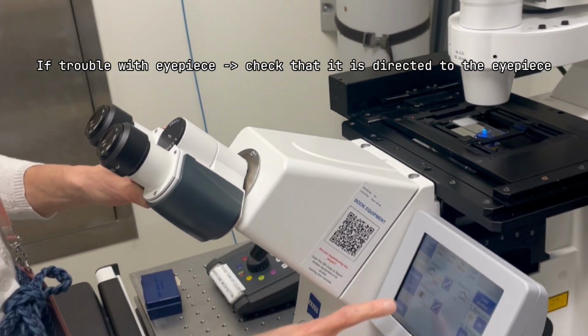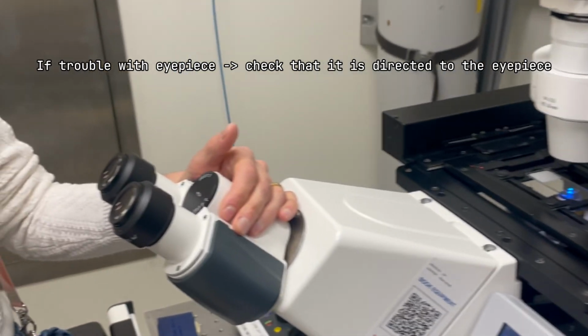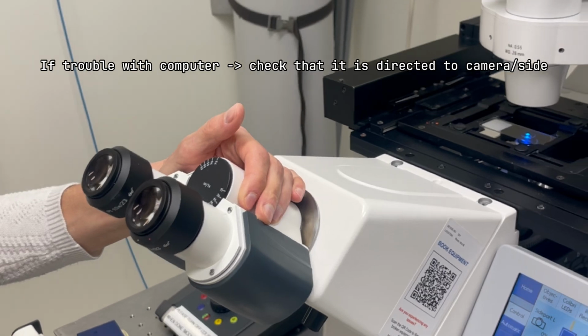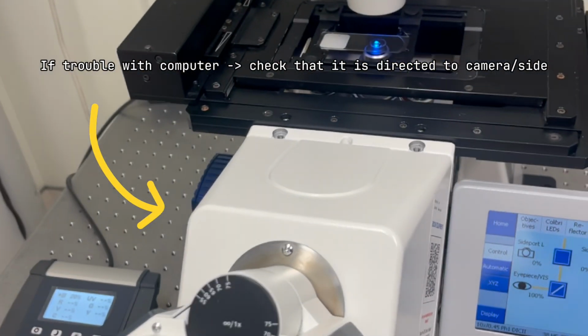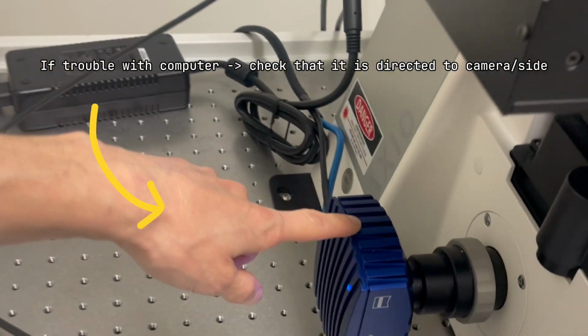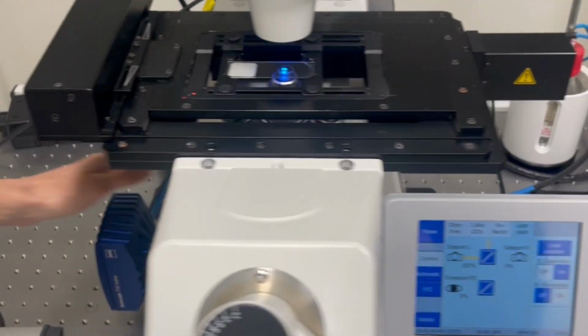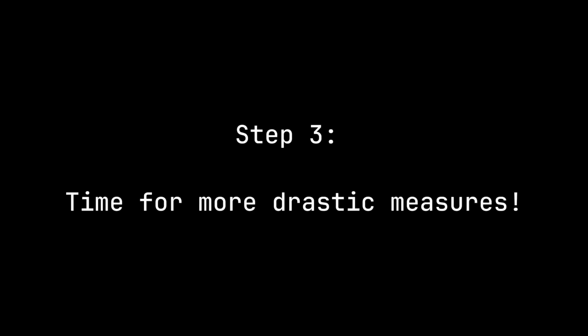If you're having trouble viewing it at the eyepiece, you want to make sure that the light is directed to the eyepiece. If you're having trouble viewing it on the computer, you want to make sure that the light source is directed towards the camera, or the side. On other systems that are not camera-based, you'll want to make sure that the light is directed to the scan head. If you're still having problems, you see the light source, you're directing it to the right place, and you don't see anything on the screen, then you'll have to make more drastic efforts.